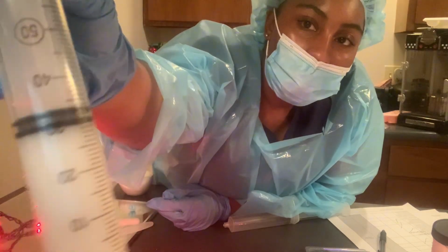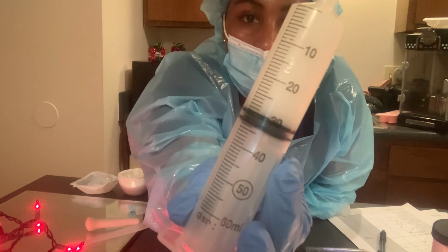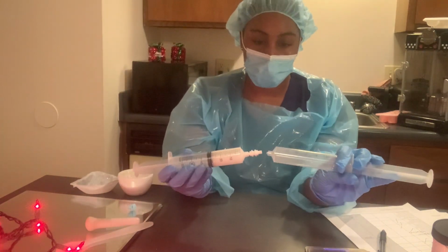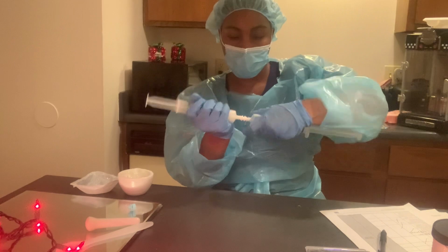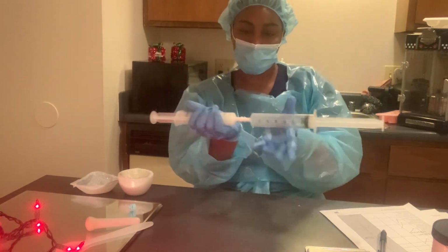So, there it is. Okay, so we're going to grab this. Make sure that it's in there. Twist it.